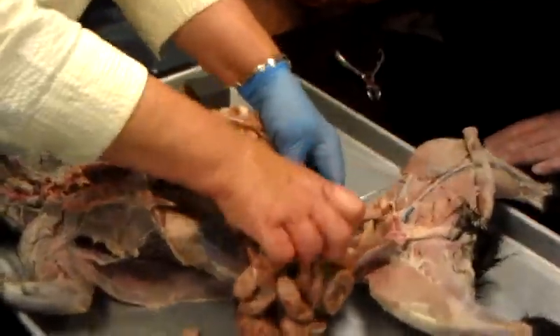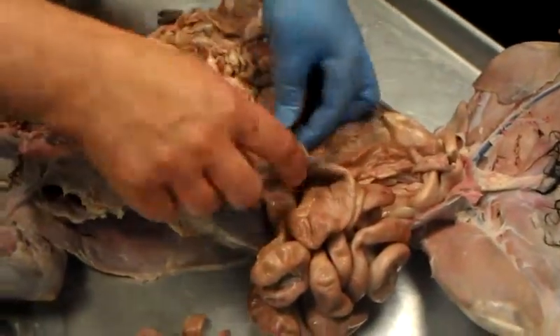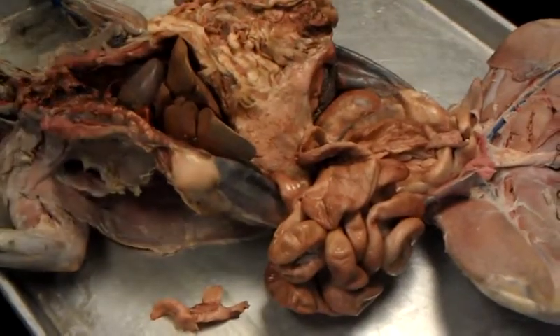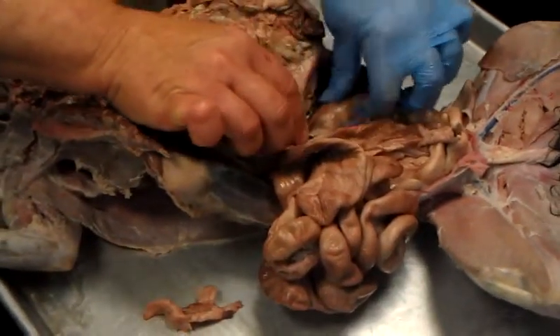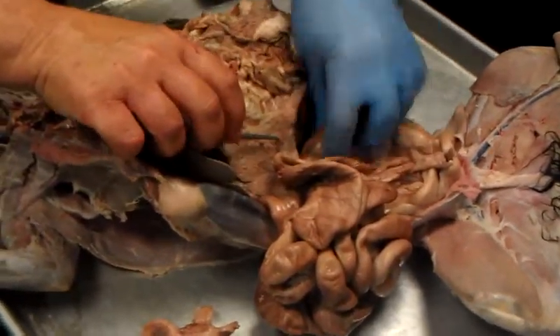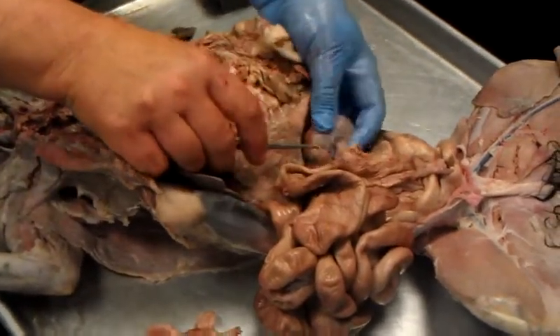Now what else is on there? The kidneys. I know you did them last time, but we're still going to look at them. Remember, they're retroperitoneal. So is the pancreas. You can sort of see how the pancreas is retroperitoneal there. What does that mean, Richard? Behind the parietal peritoneum. I'm going to dig the kidney out. There's a lot of fat around the kidney. Okay, but this would be the kidney, right?